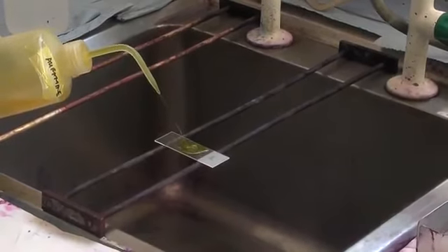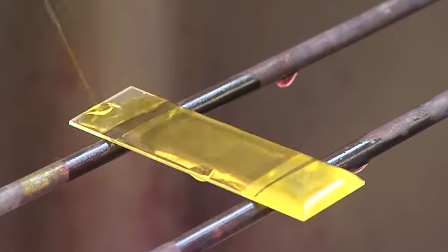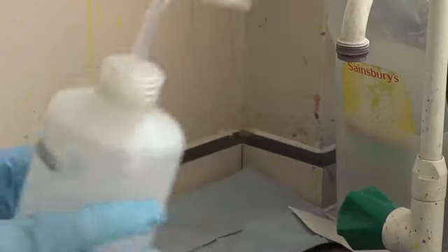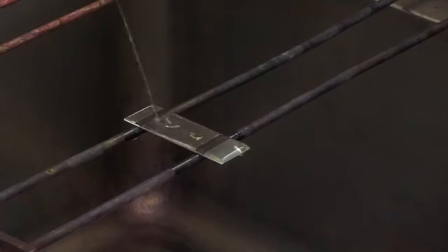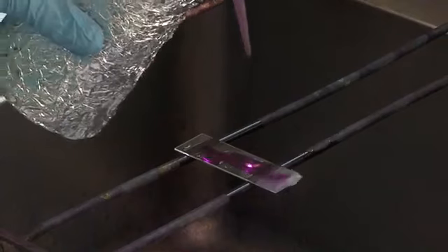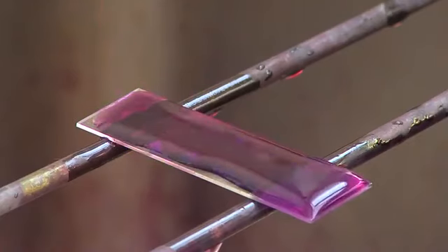The auramine phenol stain procedure involves staining the slide with auramine phenol for 10 minutes, washing with sterile water, and then adding 1% acid alcohol for 5 minutes, and washing again with sterile water. The slide is then counterstained with 0.1% potassium permanganate for 30 seconds. The auramine phenol penetrates the cell wall of the mycobacteria and is not removed when exposed to the acid alcohol. The acid and alcohol fast bacilli then fluoresce yellow-green when examined under a fluorescent microscope at ×400 magnification.